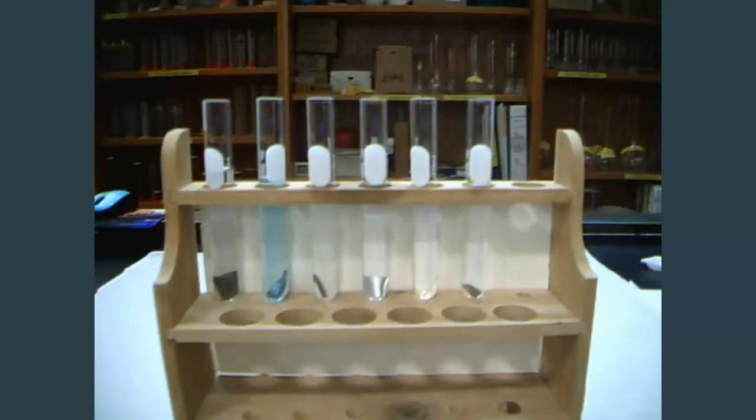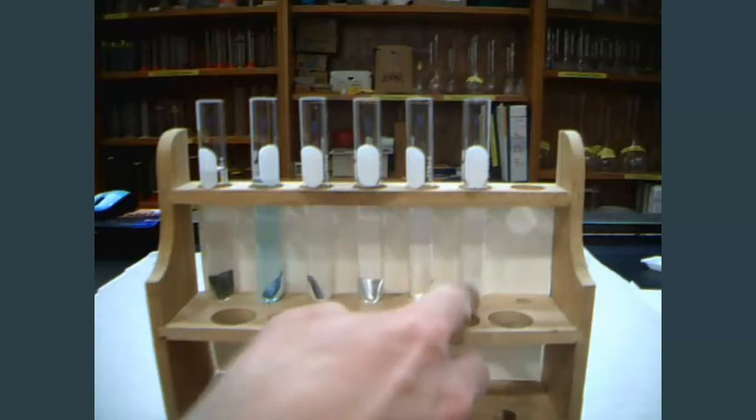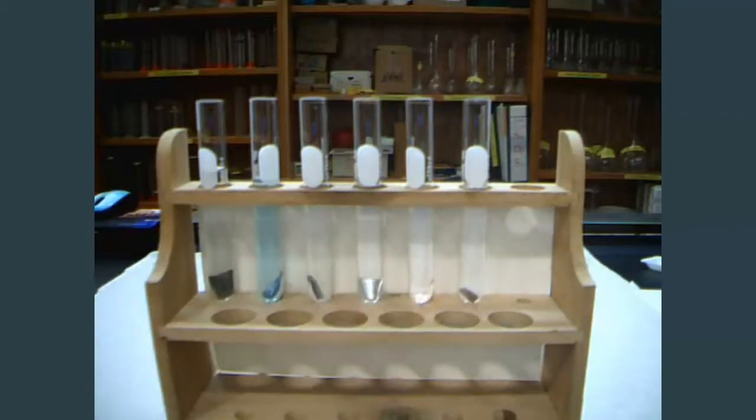Now that I've got the camera moved closer, we can definitely see bubbles down here on the zinc. The rest of them, it looks like we've got some reactions starting. But what we're going to have to do is we're going to have to wait about ten minutes and then see for sure what evidence of chemical reactions that we have.